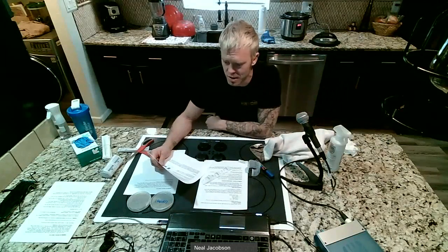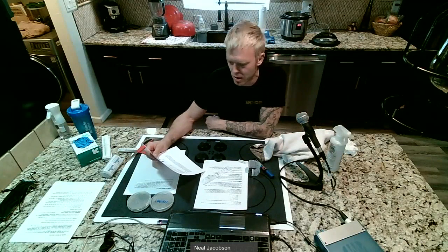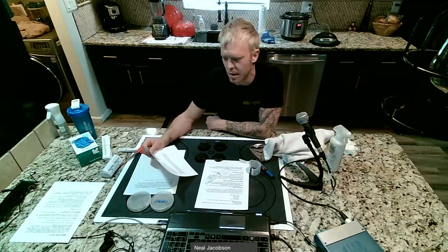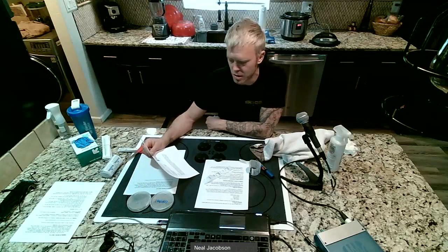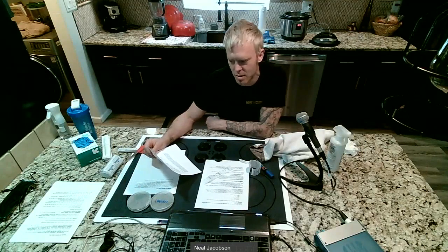So my prediction is about the after side of my plate that I just made. Will it have greater or less than the number of bacteria on the before side? So that's just number of colonies. That's not diversity yet. And then I can answer after hand washing, the diversity, that's the different types or kinds of bacteria on the after side. Will the after hand washing side have greater than or less than when it comes to diversity of bacteria from the before side of the plate?